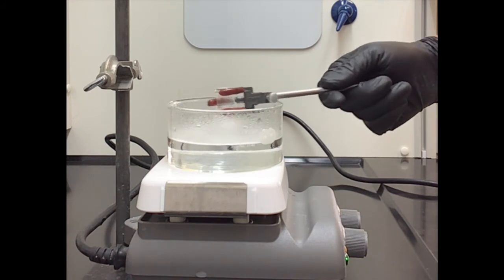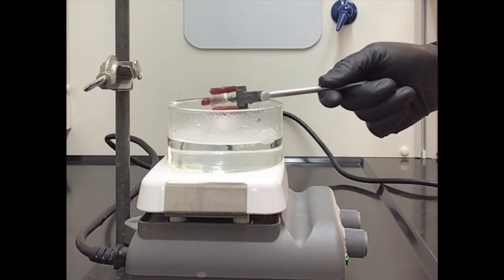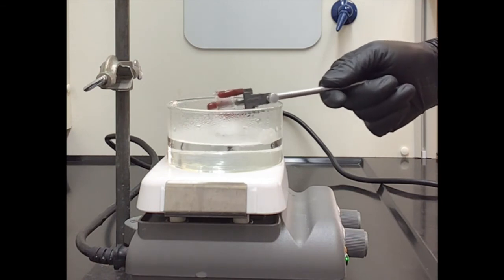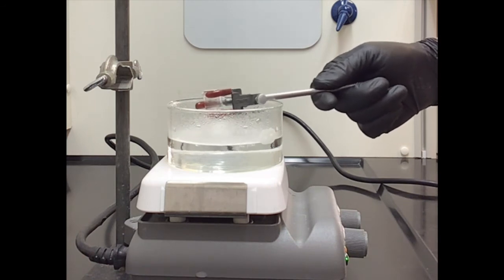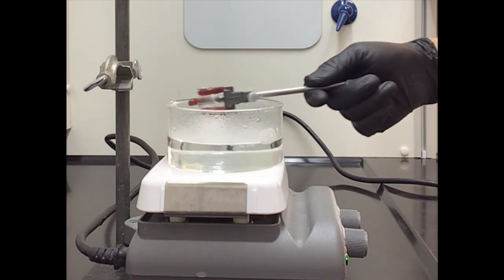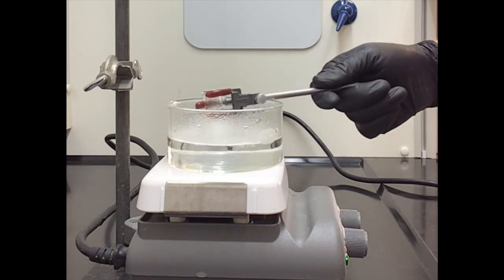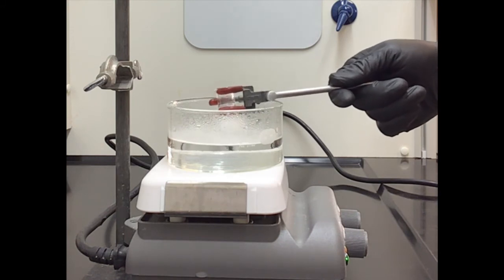And so I'm moving it to kind of stir it so that it doesn't boil over and we won't have any disasters. You don't really want to watch me do this for a while, so I'm going to turn the video off and we'll meet back once we get that solid caffeine left behind. And one thing we want to note is we just do not want to overheat it. Once we get that solid material visible, we're going to take a look at it and be careful as to when to stop. Make sure all the liquid is gone, but also not heat the solid too much.